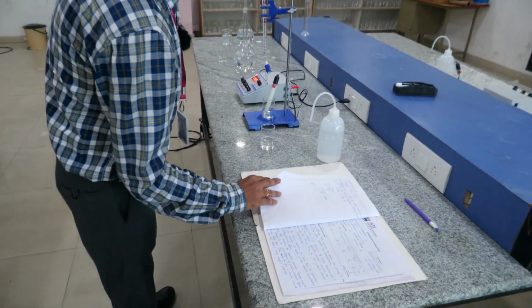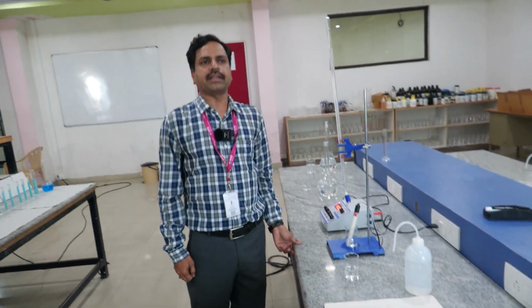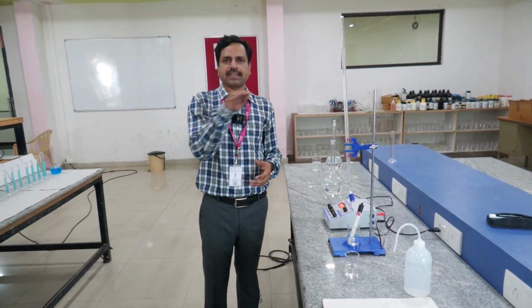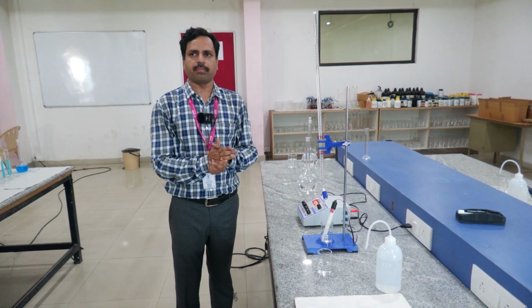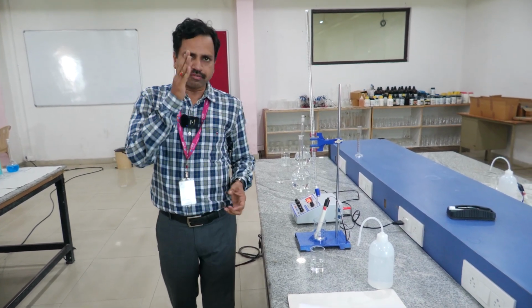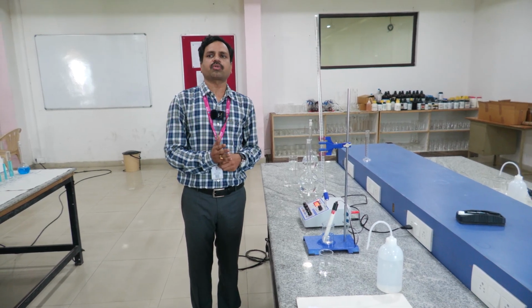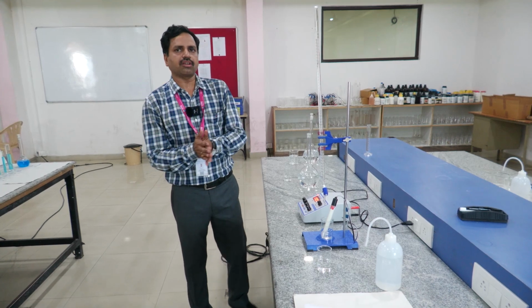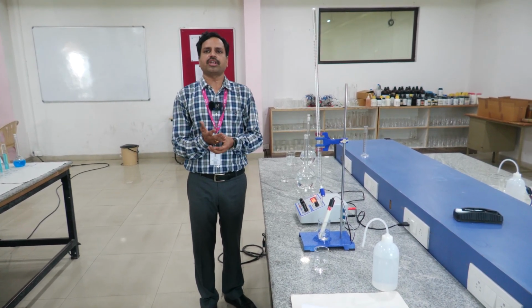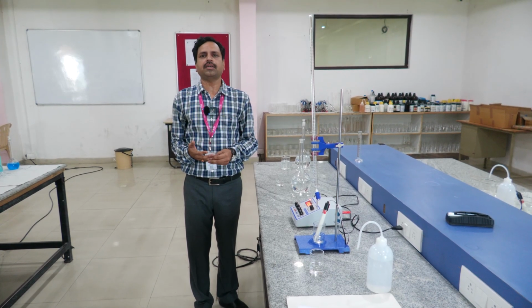After the calculations, when you draw a graph by taking volume of NaOH on the x-axis and conductivity on the y-axis, we get a V-shaped graph. If you join all the points and find where the V meets, that is your neutralization point. After drawing the graph, we use the formula N1 V1 = N2 V2, so we can calculate N2.